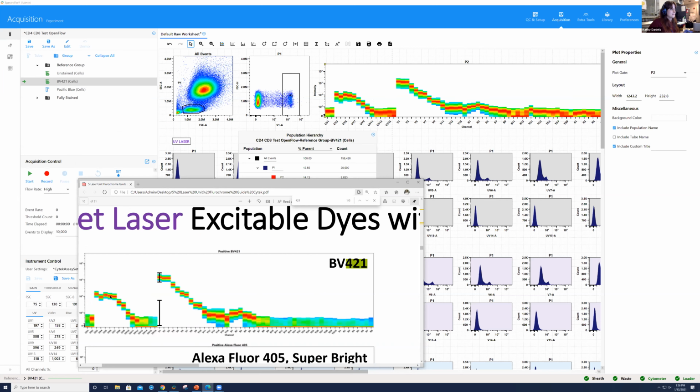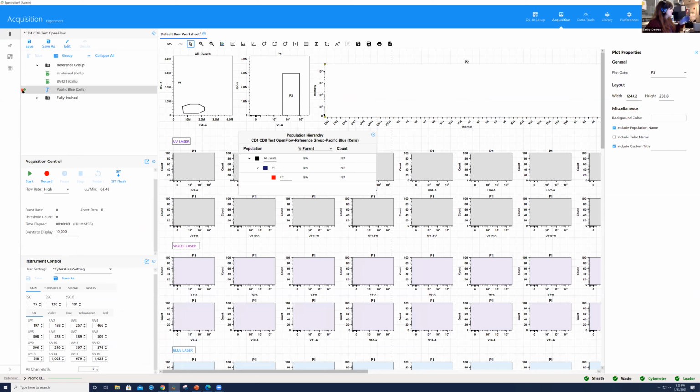We have a bit of excitation off of the UV, namely around UV 3, 4, 5, 6, and it tails off, which is what we're seeing here in the software, and then the same off the violet, okay? So I did check these on another instrument earlier, and I'm not going to go over the Pacific Blue, but these had been checked earlier to make sure the signatures did match up. I just wanted to reiterate that that is something very important to do. Okay. Select Pacific Blue, go ahead and start that sample, and then we're going to record so that we can get started with our unmixing to see how these results look.